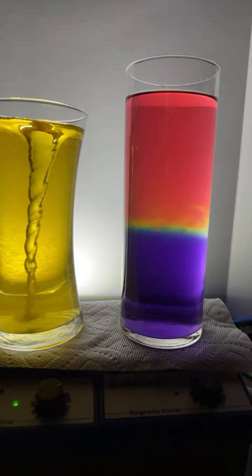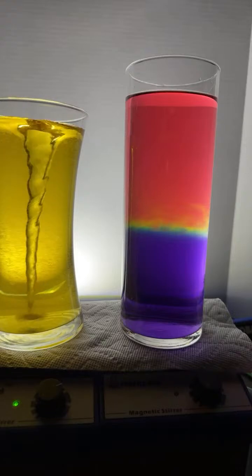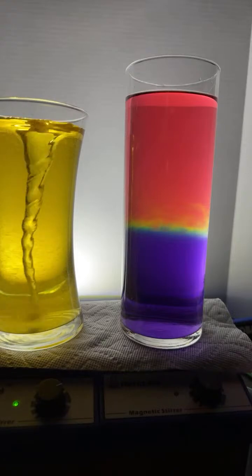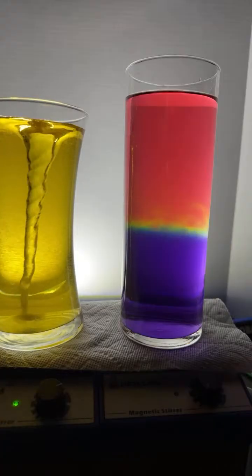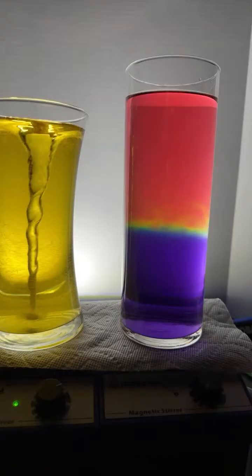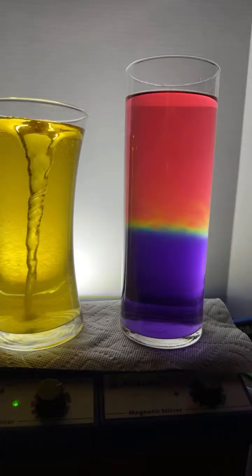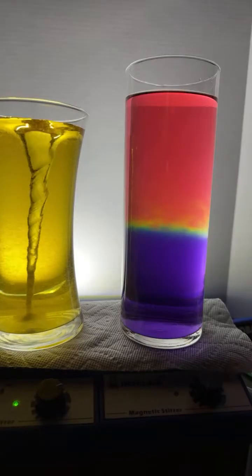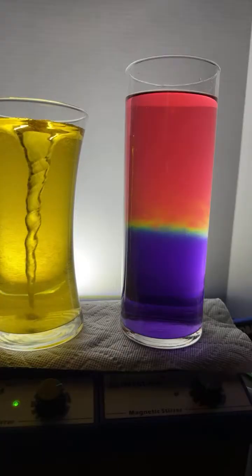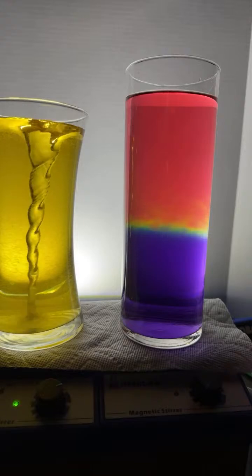I'm trying to find a stir bar to mix everything up with. We got an orange. We got a green. Hello there, Abdullah. Megan is guessing. We got a purple. We got a red. Zarian's saying more reddish, so Zarian's saying it's going to be on the acidic end. Samuel's going green. Noel blue. Edward red. Worrisome, pink. We got a green. Oh my goodness, they're coming in. A brown. It's not going to be a brown, buddy. I can't make brown out of this stuff.